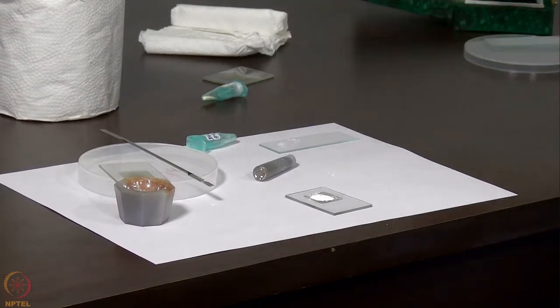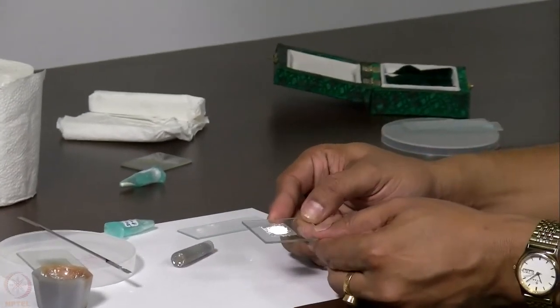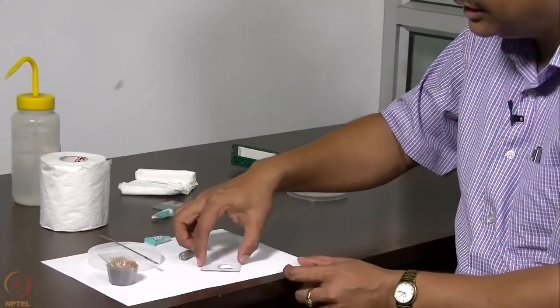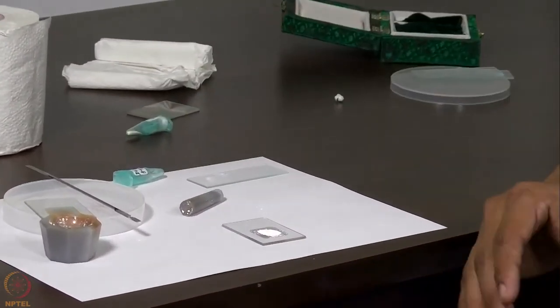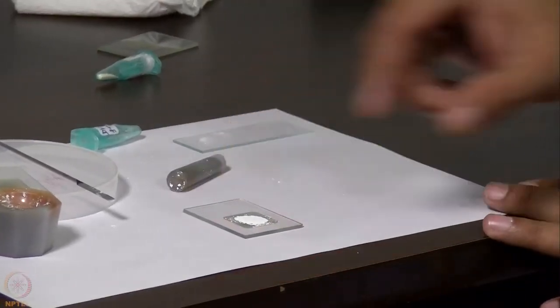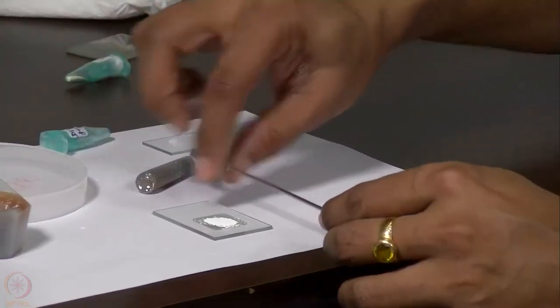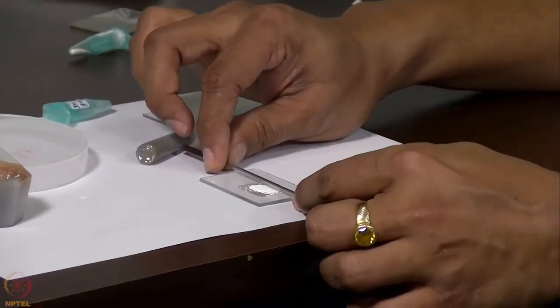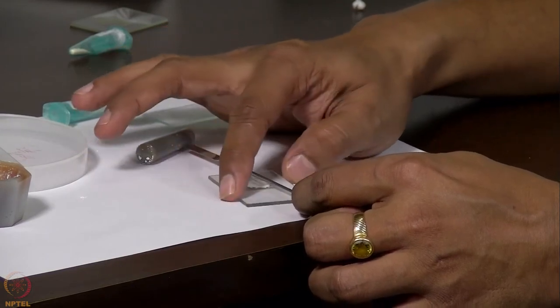On the diffractometer, we will place this sample in front of the X-ray beam, and then we will make the sample rotate like this at 120 rpm so that the entire sample is evenly exposed, because the beam that we have here is a line focus, which means the beam is like a line like this, and if we rotate this sample below the beam, the entire sample gets exposed to that beam.